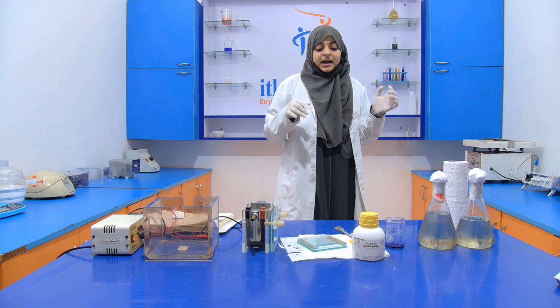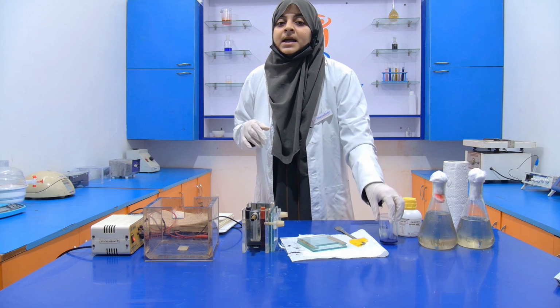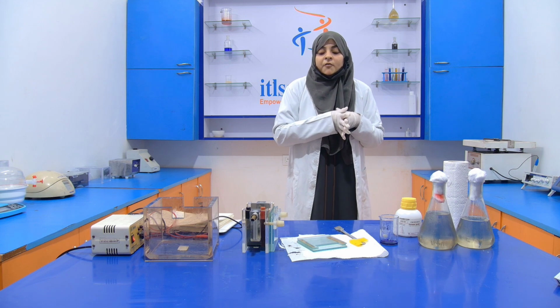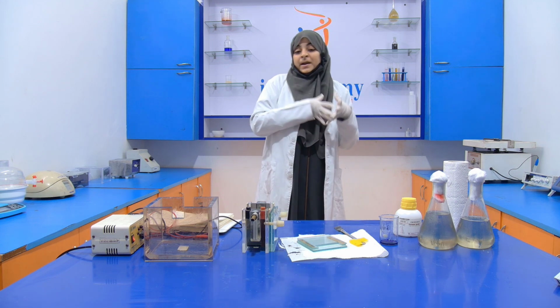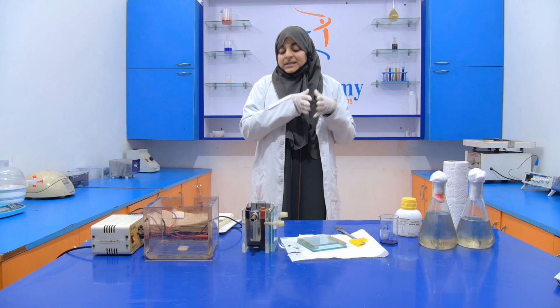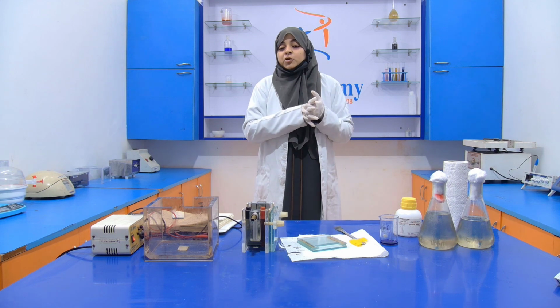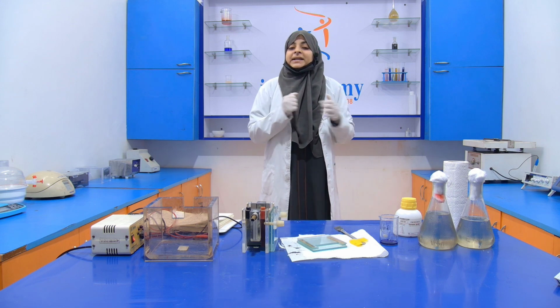Then after that, I'm going to tell you the composition of the sample buffer. Sample buffer contains 10% of SDS, 10 millimolar of beta mercaptoethanol, 20% volume by volume of glycerol, 0.2 molar of Tris-HCl whose pH is 6.8, and 0.05% weight by volume of bromophenol blue dye.